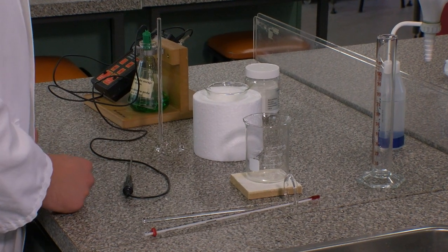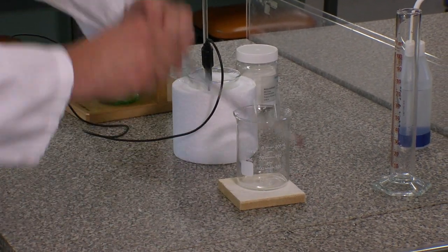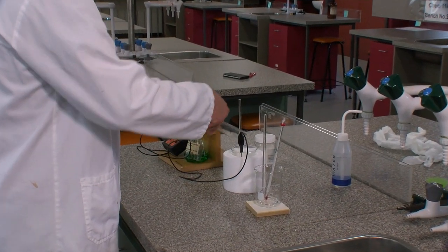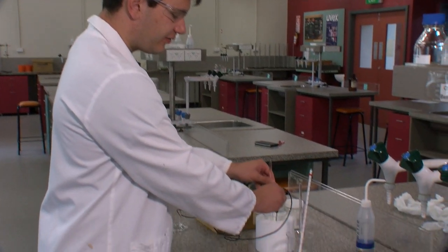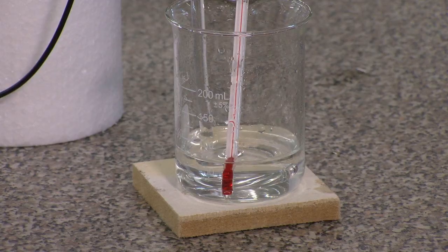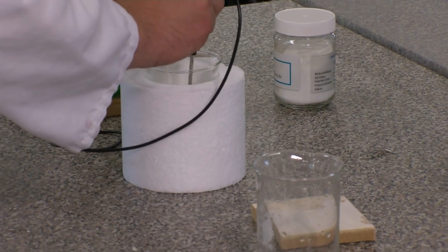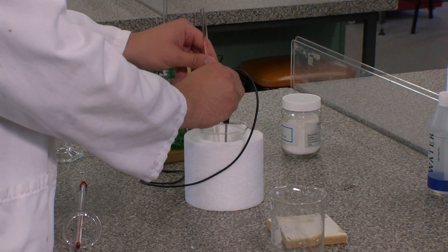Making sure your beakers are clean and dry, assemble the calorimeter once again and the stirring rod and thermometer in the other beaker. Measure out the required amount of hydrochloric acid solution and pour it into the calorimeter. Measure out the ammonia solution and pour that into the other beaker. Again, stir your solutions and take the temperature reading every minute for 5 minutes. After 5 minutes, pour the ammonia solution into the calorimeter and quickly take the temperature reading. Take the temperature reading every minute for 10 minutes as before, stirring gently the entire time.